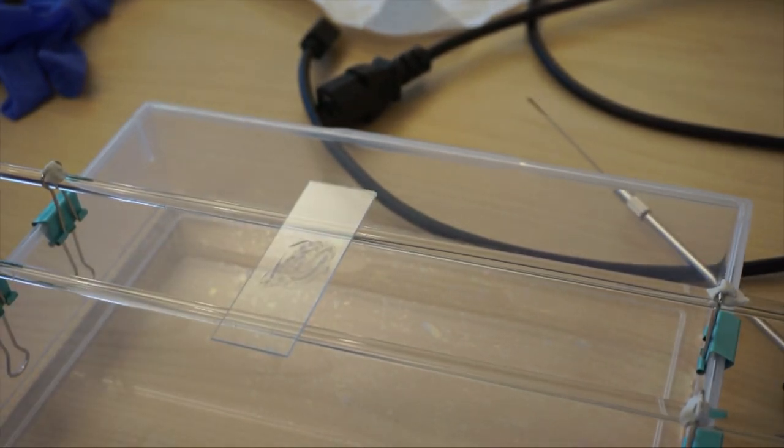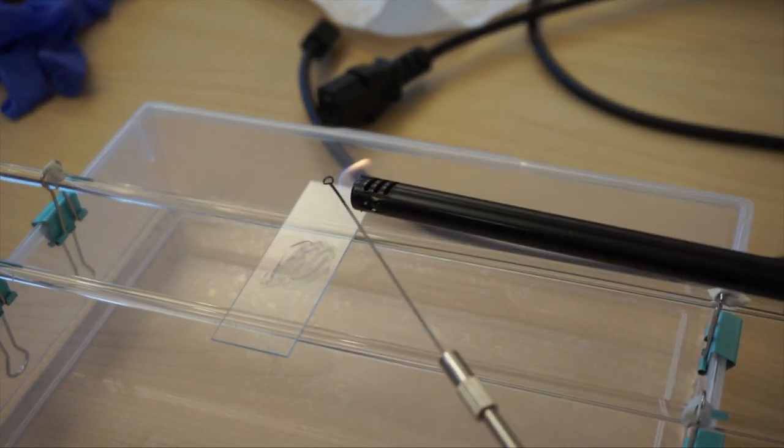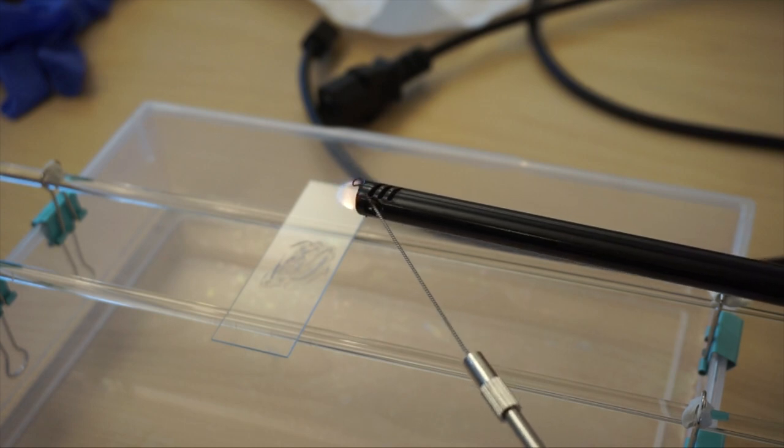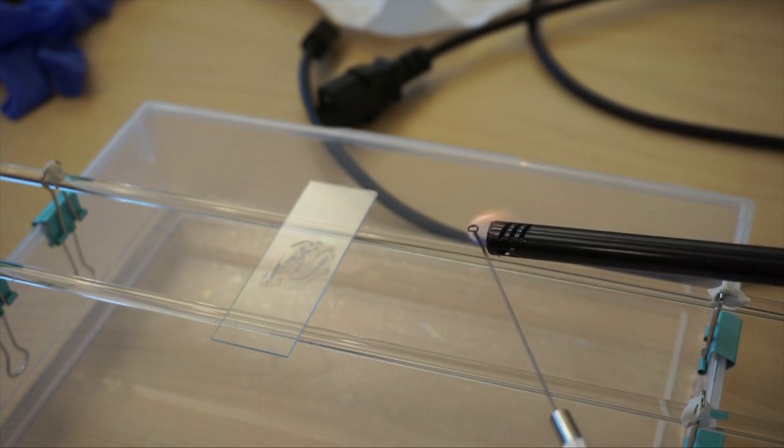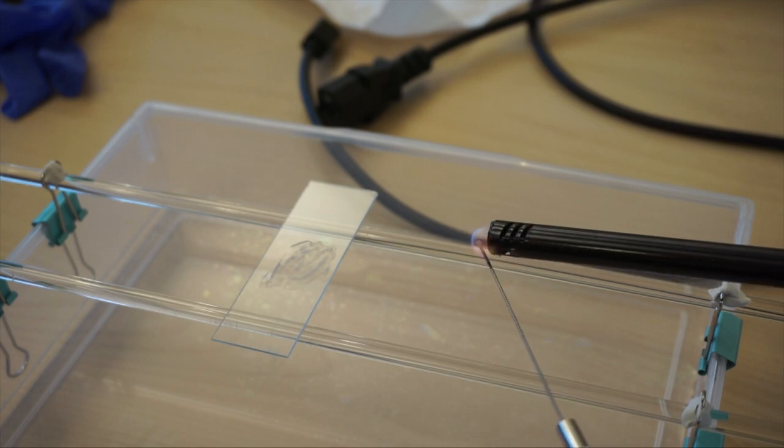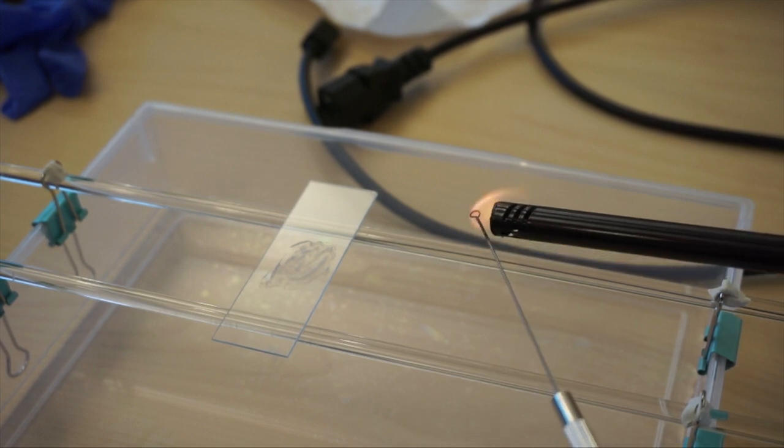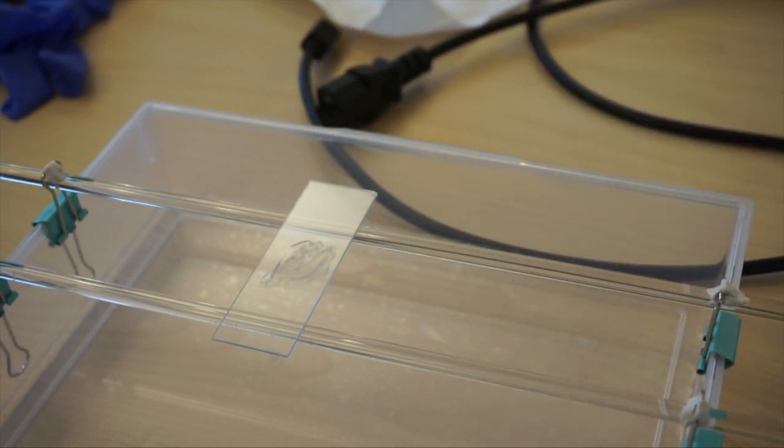You have to smear the bacteria like that. Make sure you can separate the bacteria to ensure good observation. I got a little bit on the other bit of the slide which I don't want. So take that and wipe it off. I don't want that touching my microscope.